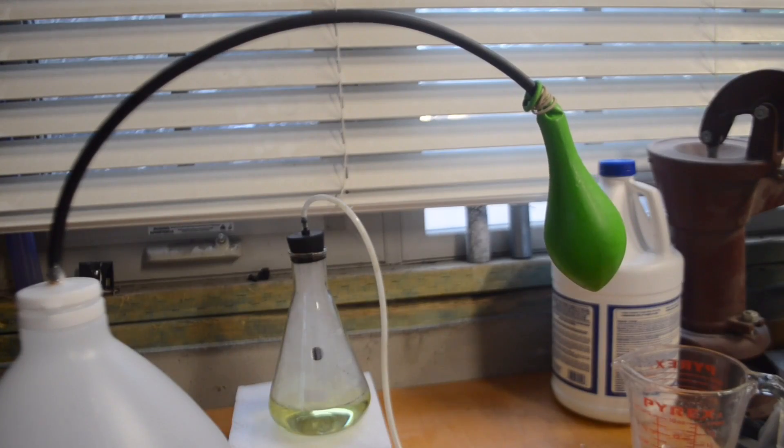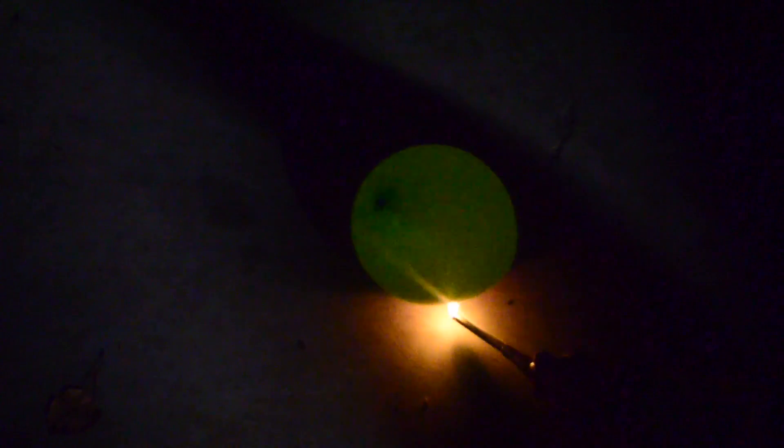You're watching Keystone Science, and in today's episode we're going to show you how to generate hydrogen using a little bit of chemistry.